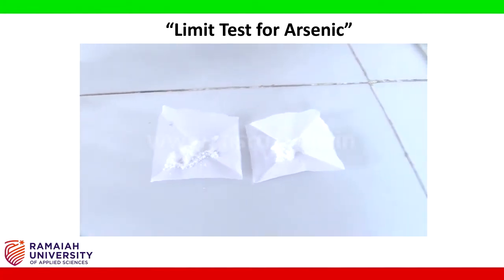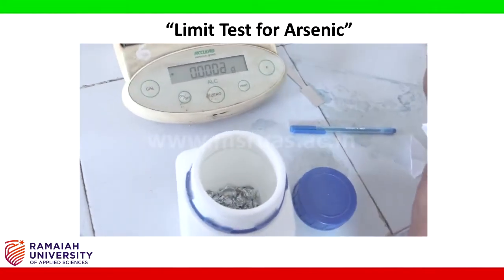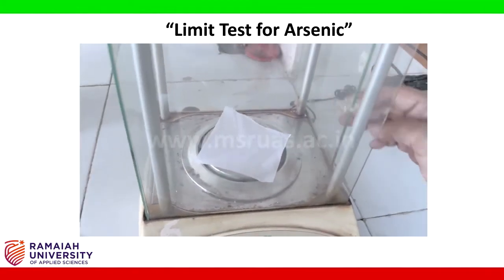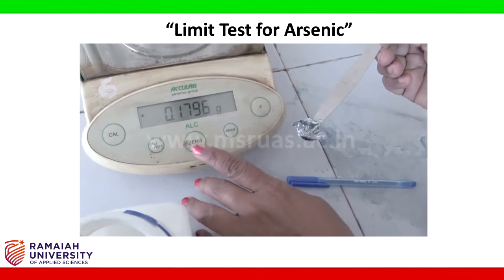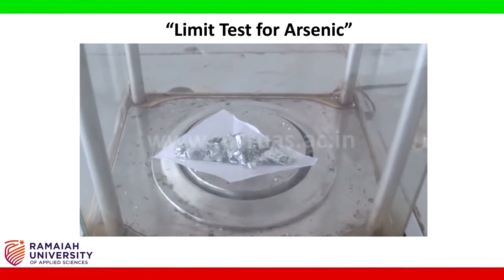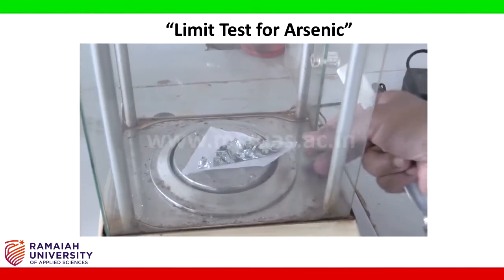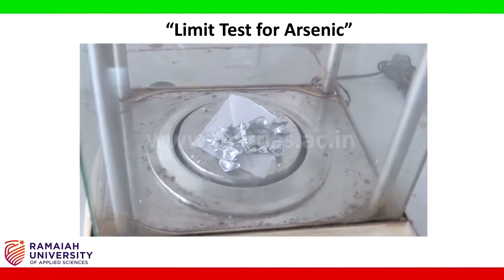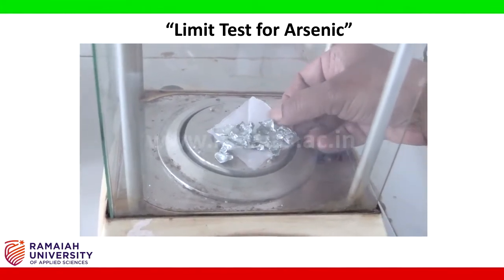Now we'll weigh 10 grams of zinc granules. Approximately 10 grams of zinc granules. Similarly, weigh one more 10 grams of zinc granules for the sample solution.